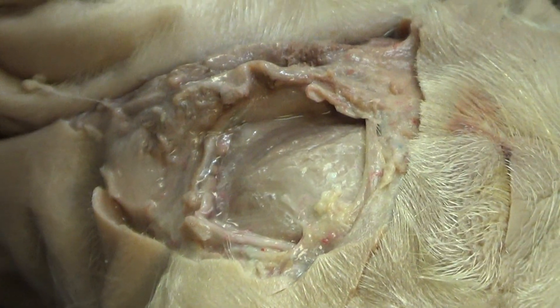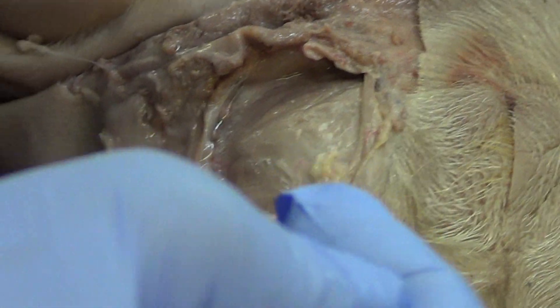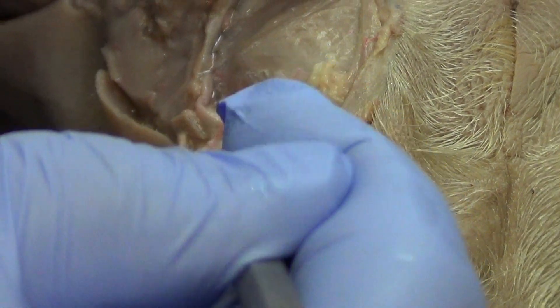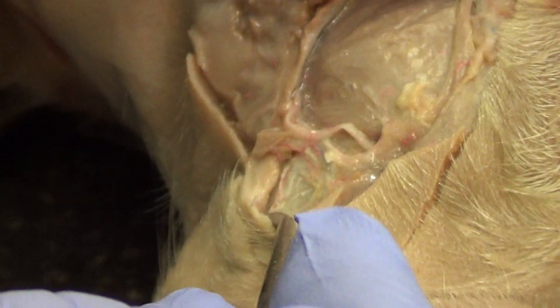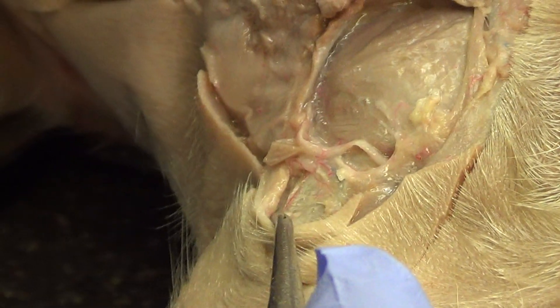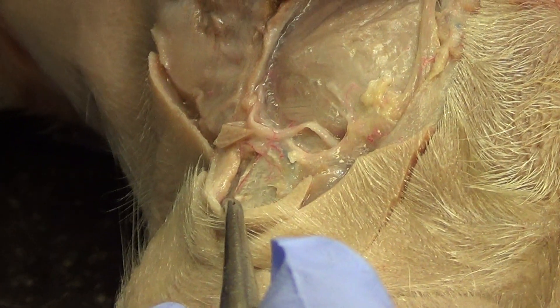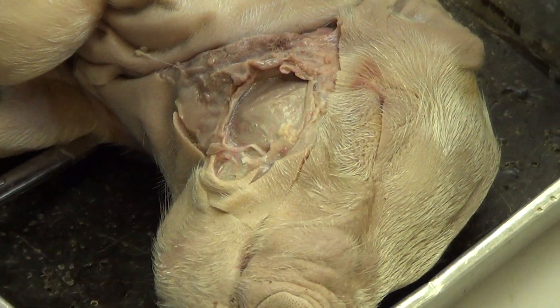As far as internal structures, that's about it. The last thing is I can expose the mandible — take a little connective tissue off right here and I'm literally scraping the mandible. Remember, the mandible is the lower jaw, and for us it would house 16 teeth and support the lower face.